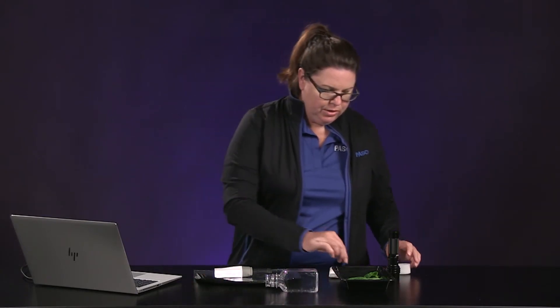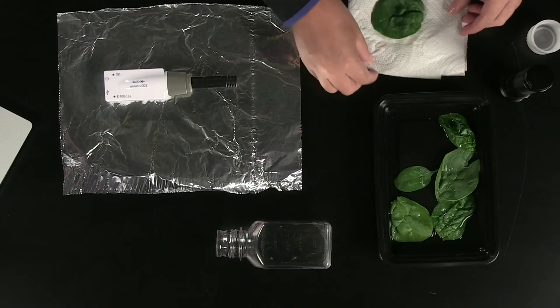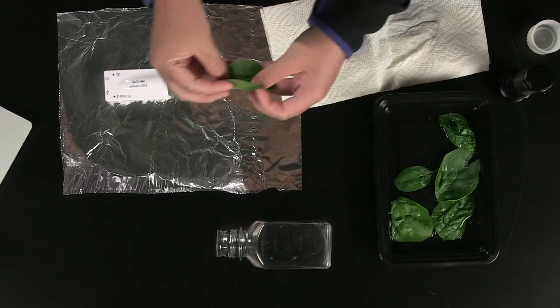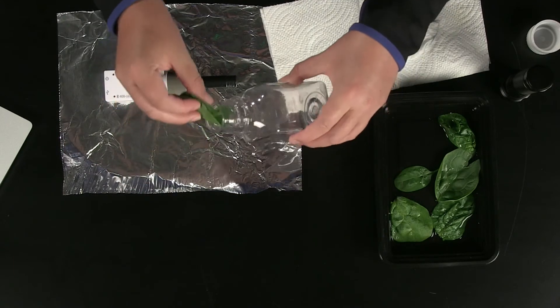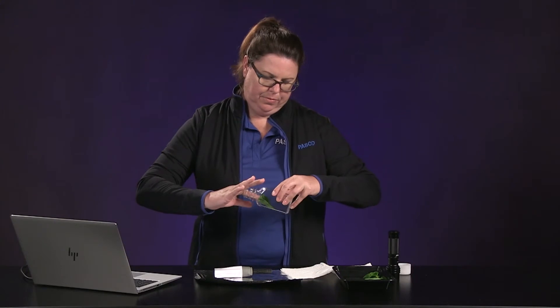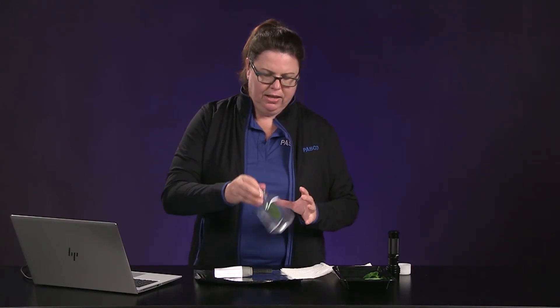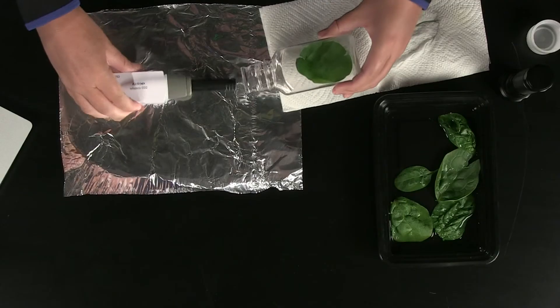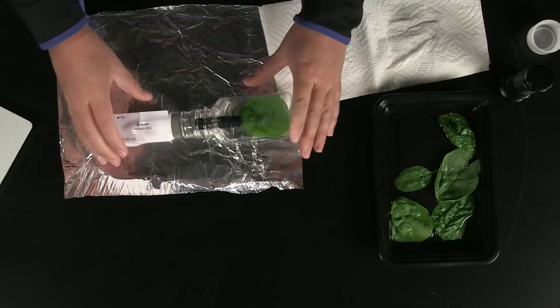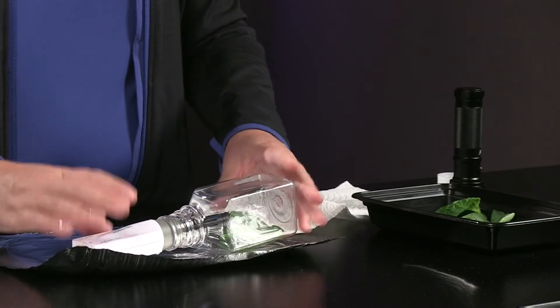Get a good spinach leaf, blot it dry, and put it into the sampling bottle. You can use a pencil or something if you have it on hand to get it in there. Then secure the system with the CO2 sensor. Make sure your leaf is face up. After putting the sensor back into the bottle, make sure you have a good seal and let it sit for about a minute before getting started.